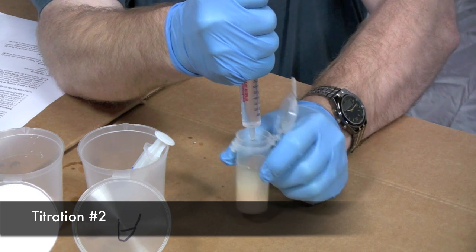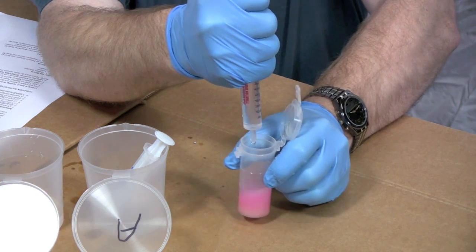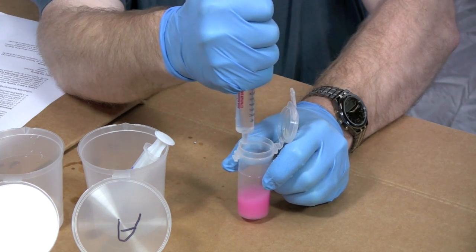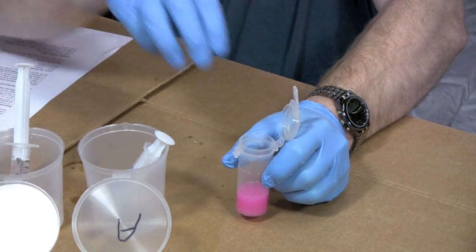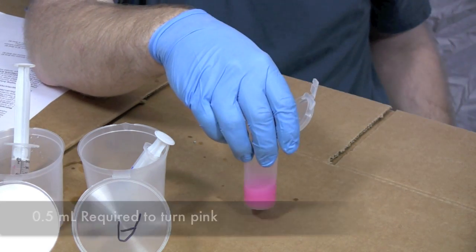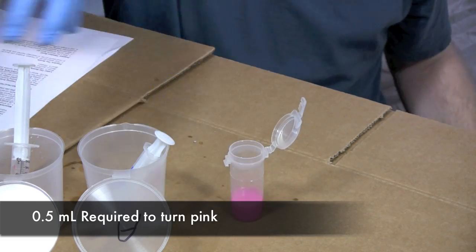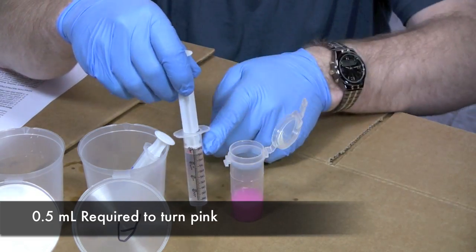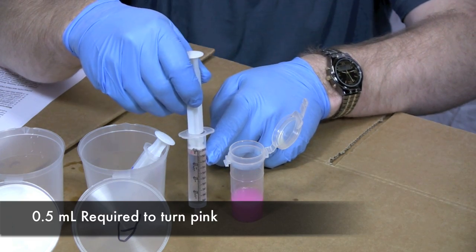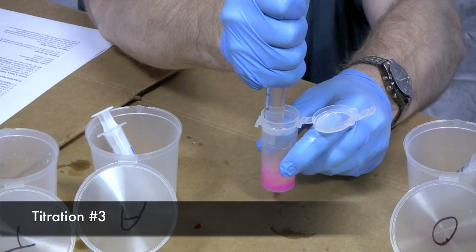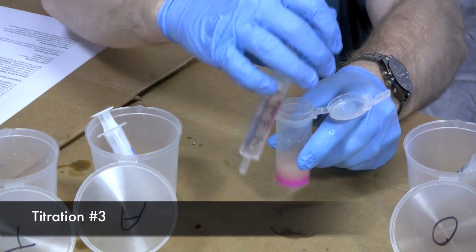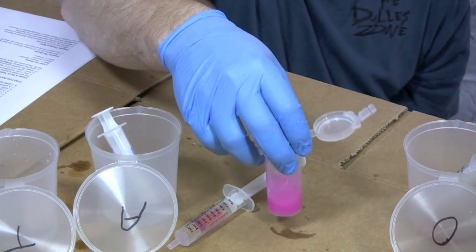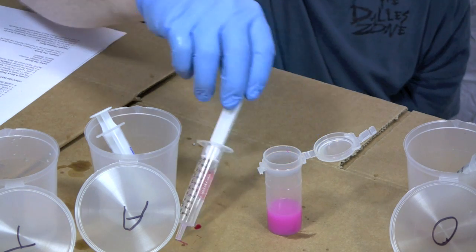There it's starting to change a little bit. There we go. Look at that. That's it. This time it took a half. So if you look at my syringe here. I started at 10 and now I'm only to 9 and a half. There she's going pink. I'm going to shake that around. And I would say that we're done.